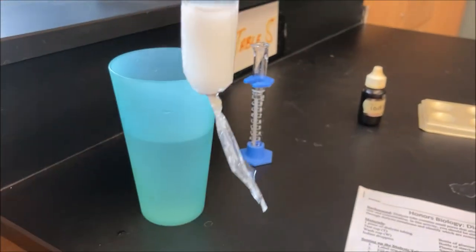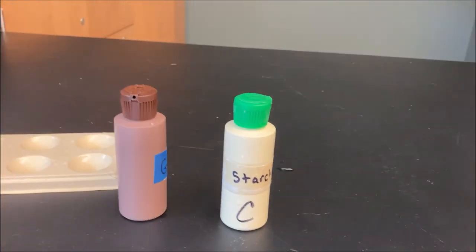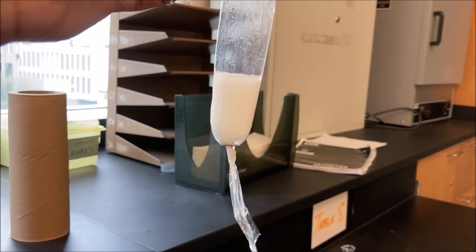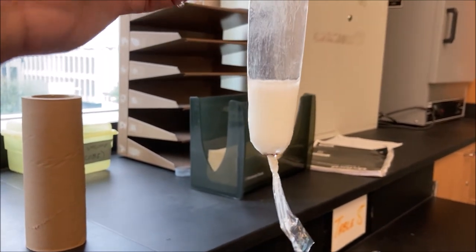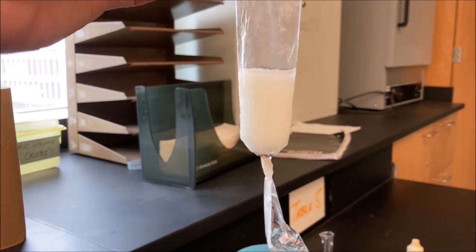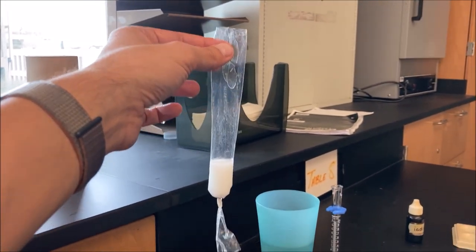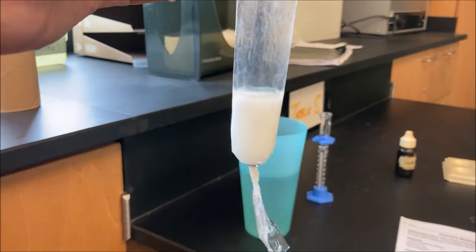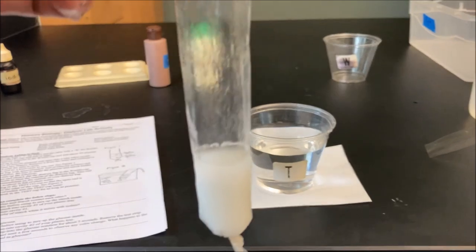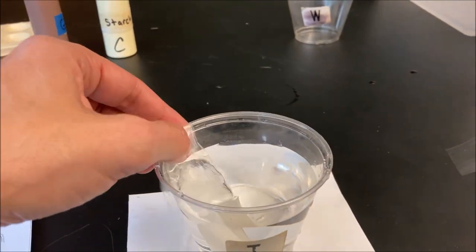I used the graduated cylinder and measured five milliliters of glucose and starch. Here they are — mixed together. This white soupy mixture is five milliliters of glucose mixed with five milliliters of starch, so there's a total of ten milliliters inside the dialysis tubing, and you can see it's knotted closed. I'm going to soak it in this cup of water.